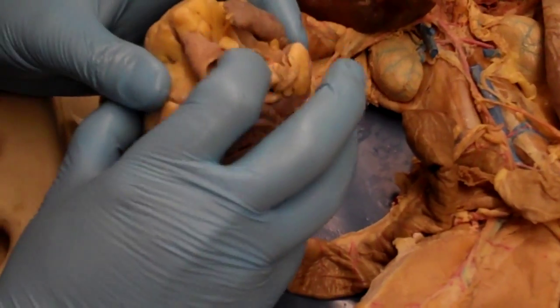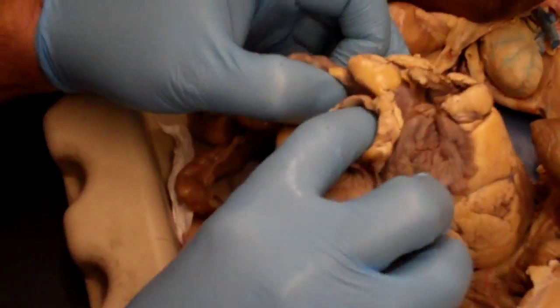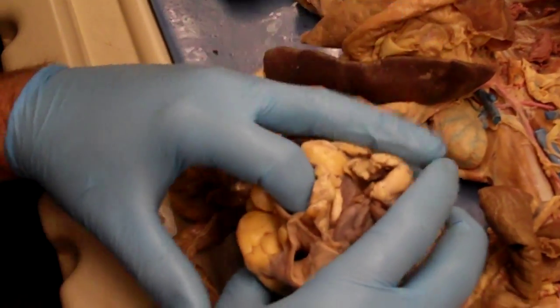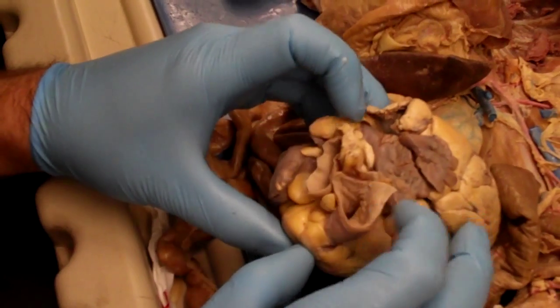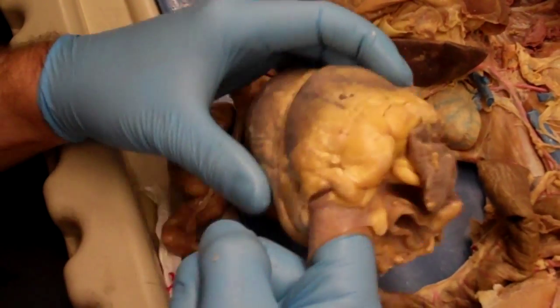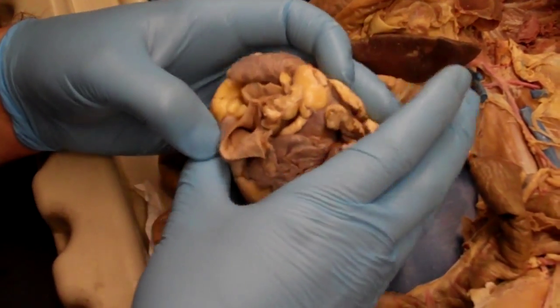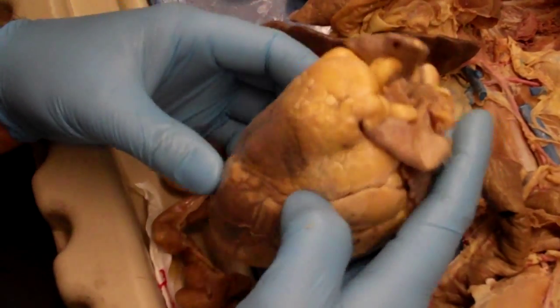In the aorta, yeah, it's really in the center of the base of the heart. So this one is going to be the aorta. This one's the pulmonary trunk. But it's hard. If you're just looking at the base of the heart, try and figure out what chamber it's going to. Because if you're only looking at it like this and you don't have a lot of experience, it can be hard.